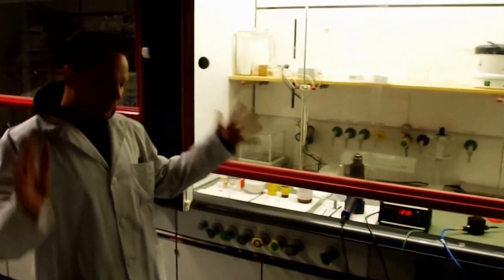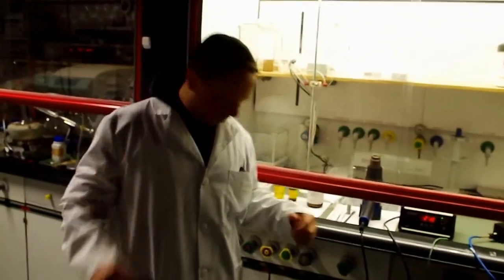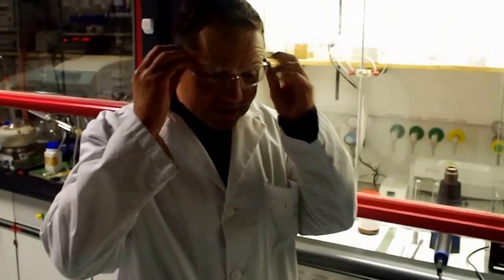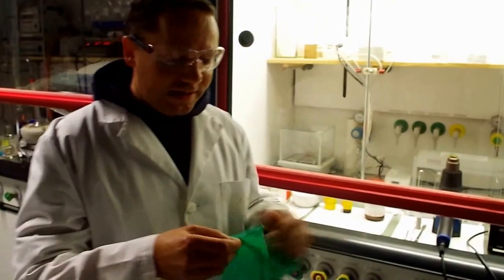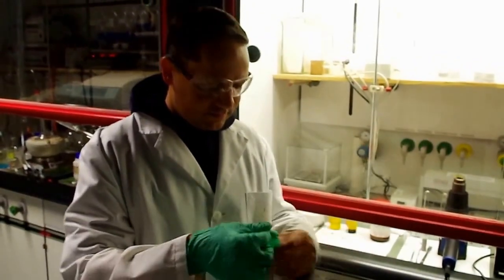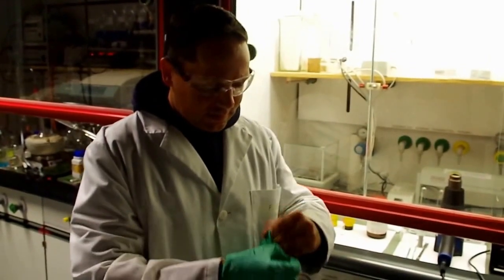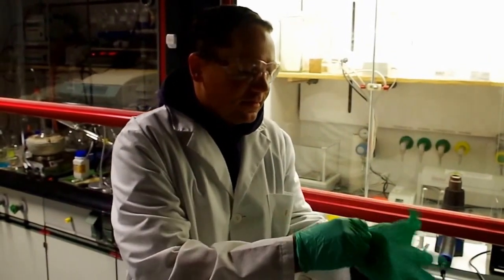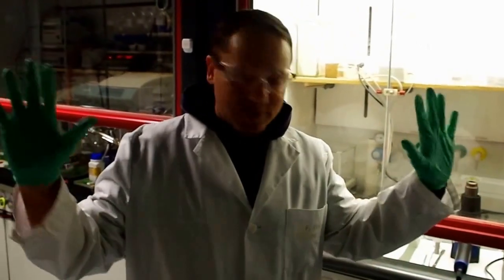Okay, before we start, security first. Protection glass. And because we are dealing with cadmium, we should not get in touch with it. Alright, ready, here we go.